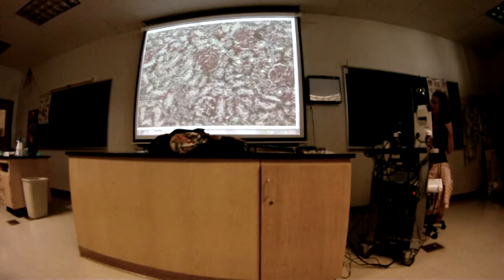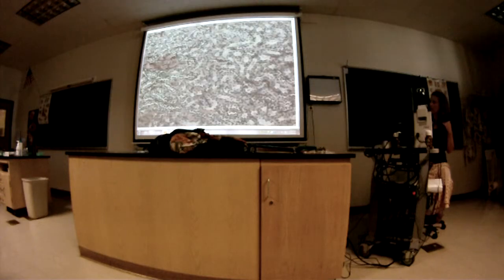But what would these be then? Convoluted tubules? No, not convoluted tubules. Collecting ducts or nephron loop. Nephron loop, right? Yeah, because I moved away from there. So this is over here. And it does look a little different. It looks like a transverse section. See, look, they look circular in this one instead of the long ones we saw in the other longitudinal section. Okay. Well, sorry, were there questions about that one? I can put it back up.